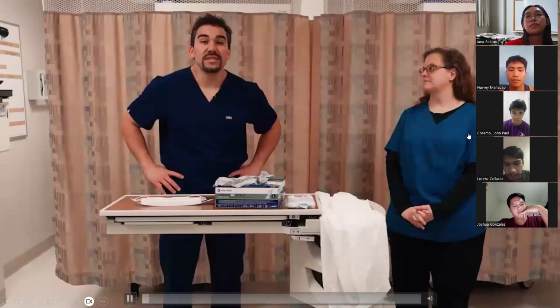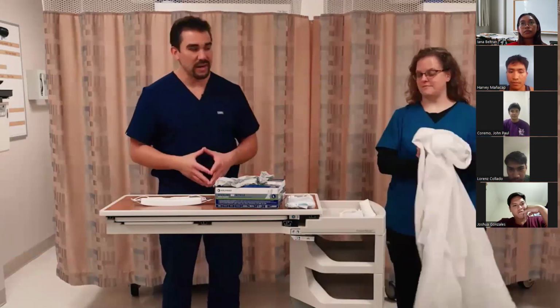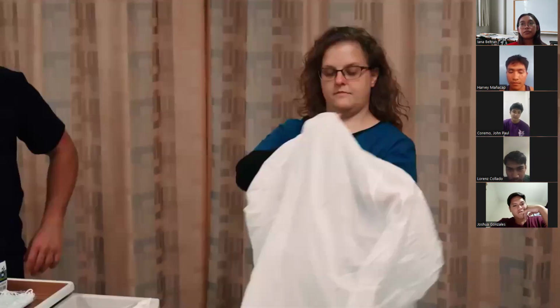Now for donning and doffing. If you ever get confused, remove the D's and it's just on and off for your PPE. To keep it super simple, we only have 4 elements. First things first is the gown for donning, or putting stuff on. So Kat here is going to demonstrate.